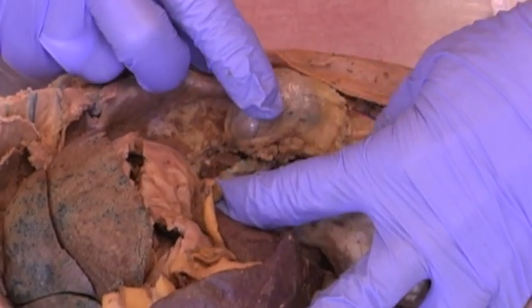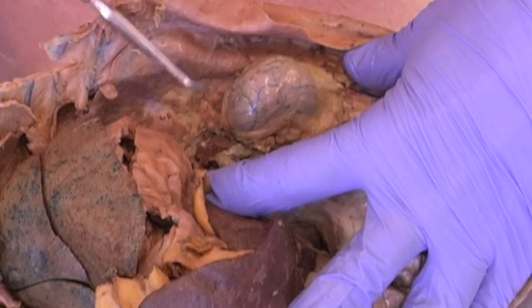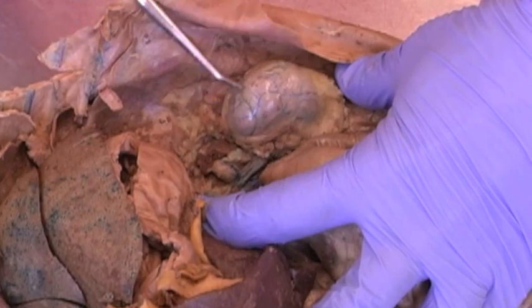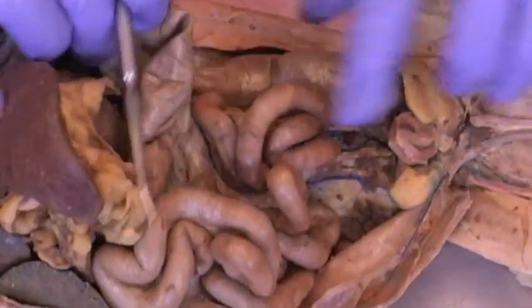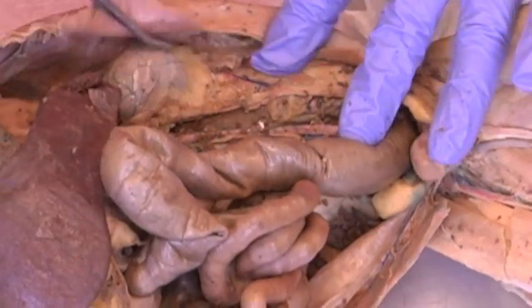Also the kidneys, there is a large left kidney, again that filters blood. And then this little structure right here is the adrenal gland, again separate. In humans it sits on the kidney. Here we have a separate gland, the adrenal gland in the cat. Also then connected from the kidney is the ureter.